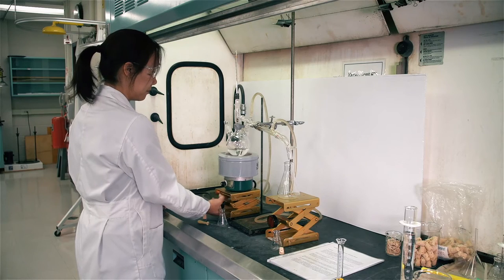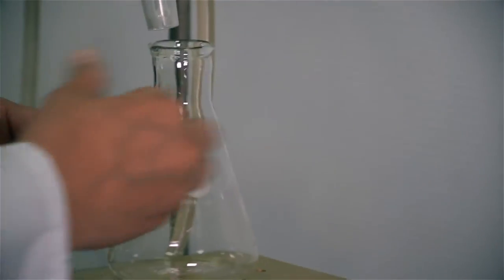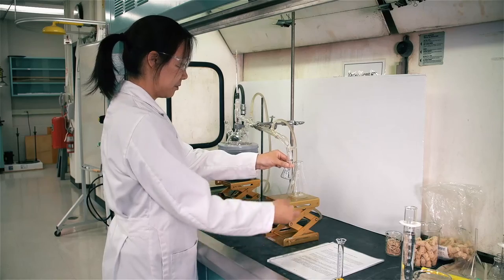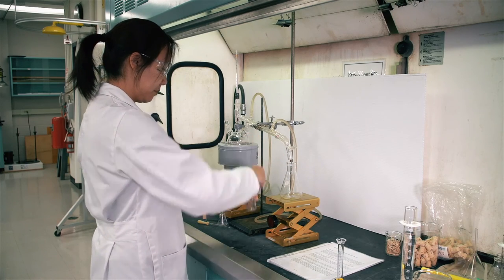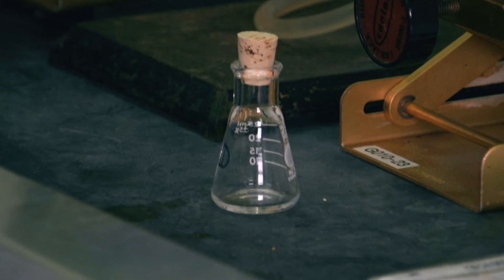Raise the heating mantle and bring the solution to a gentle boil. After three drops have passed into the Erlenmeyer flask, collect sample 1D and record the boiling temperature during the collection. Collect only enough sample to measure its refractive index. Stopper the sample flask without delay.